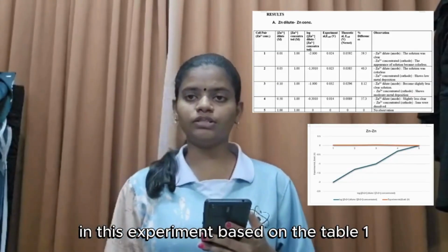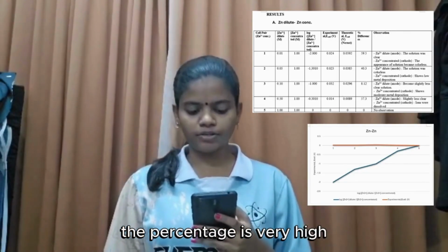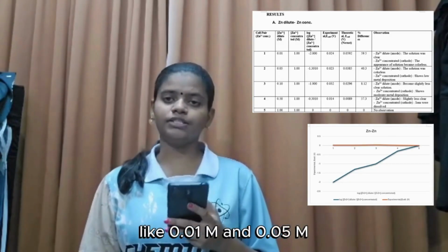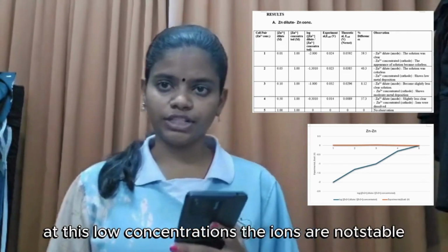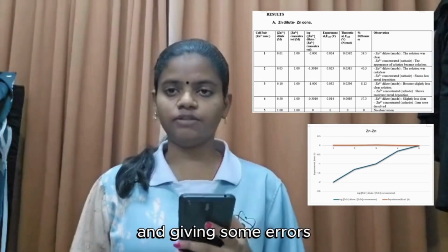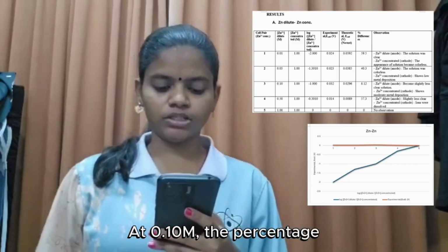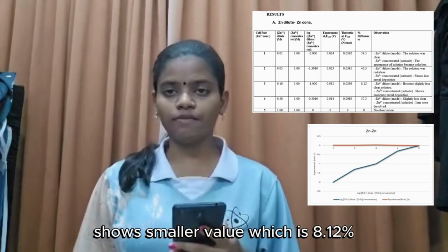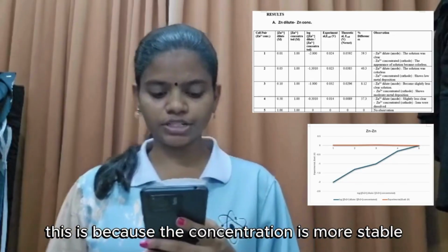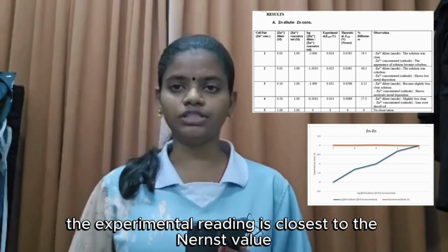Based on table 1, which shows the result of zinc, the percentage is very high when the zinc solution is too dilute, like 0.01 molar and 0.05 molar. At these low concentrations, the ions are not stable, so the voltage becomes inaccurate, giving some errors. At 0.10 molar, the percentage shows a smaller value, which is 8.12%. This is because the concentration is more stable, so the experimental reading is closer to the Nernst value.